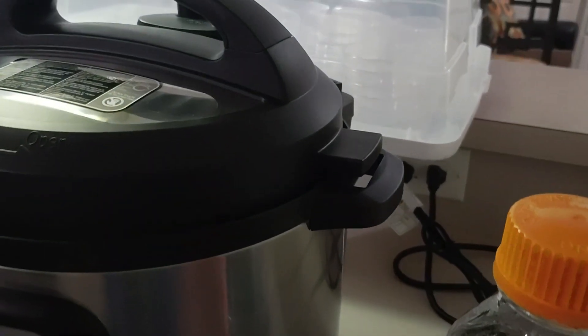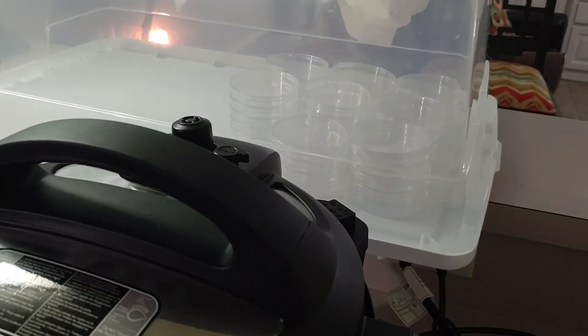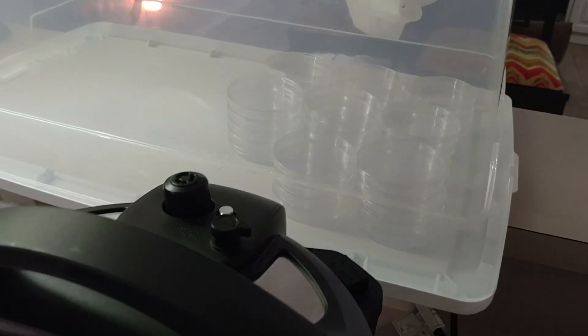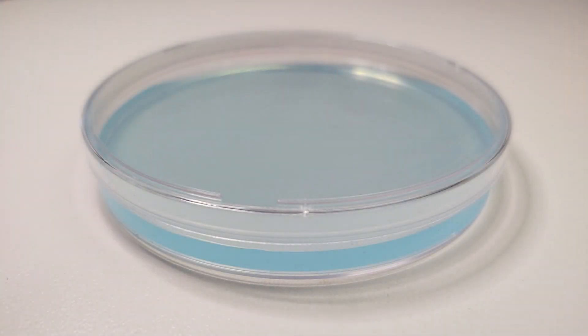We allow our bottles to cool while stirring on the magnetic plate with the heat off and monitor it with the temperature gun. Check out our sterilization and sanitization video for tips on how to eliminate contamination.